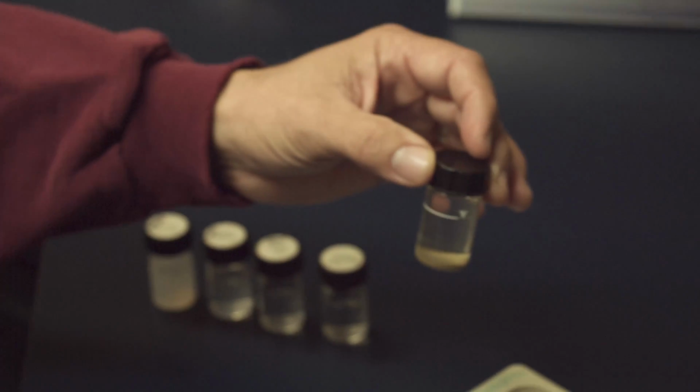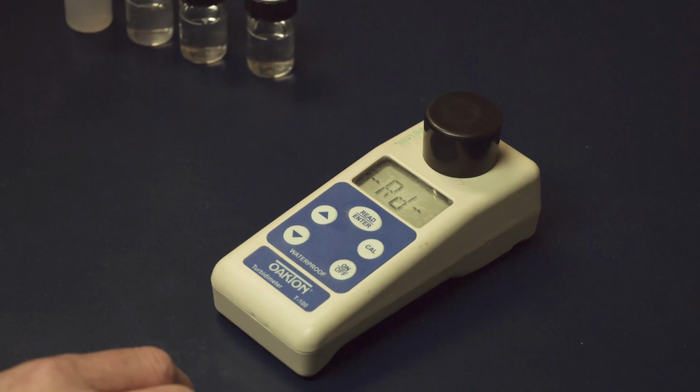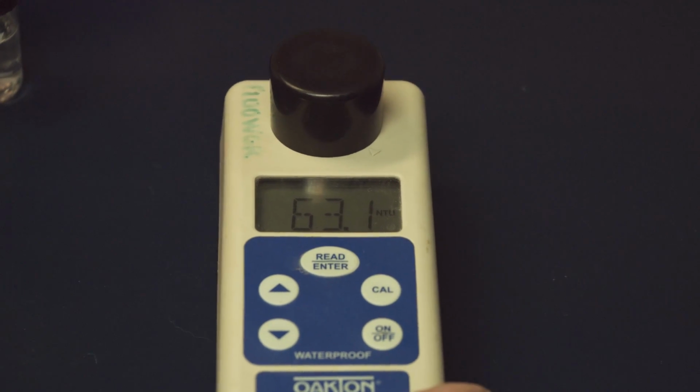Just for fun, we decided to give it a 24-hour wait just to see what it would do. Wouldn't you know, it read an abysmally low 9.56 NTU. A good shake, and what do you know, we're back at around 65 NTU.